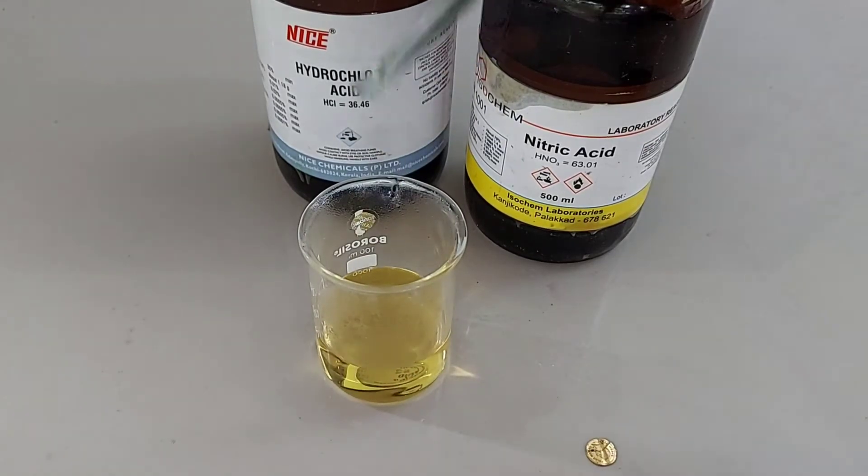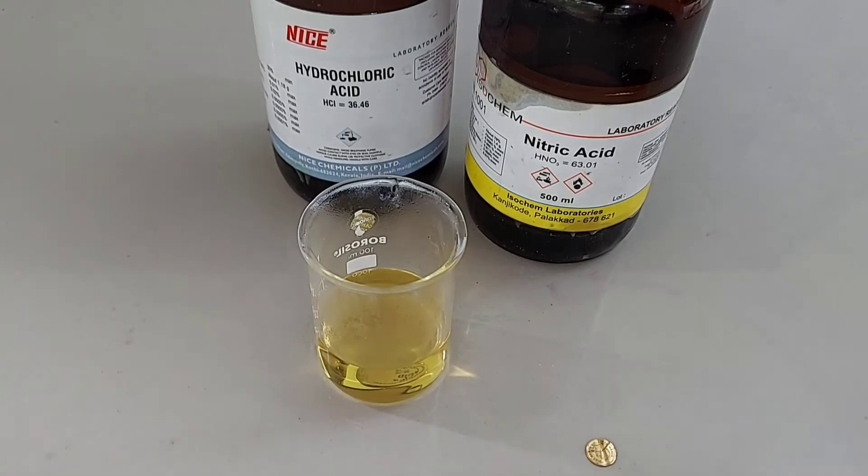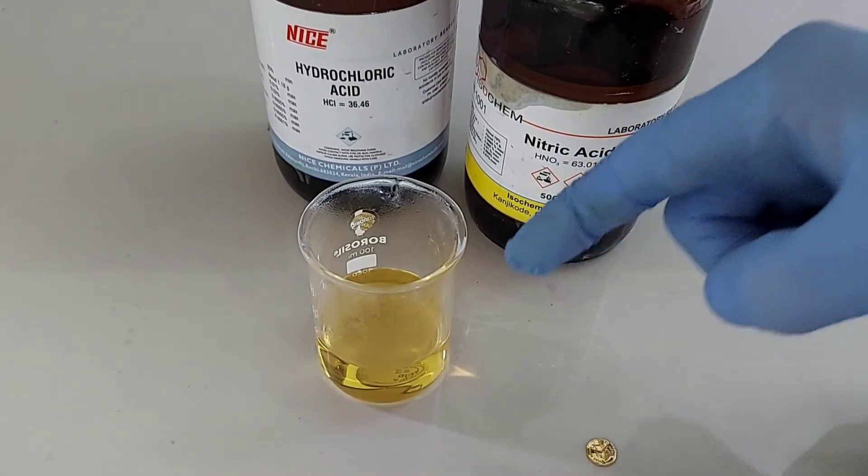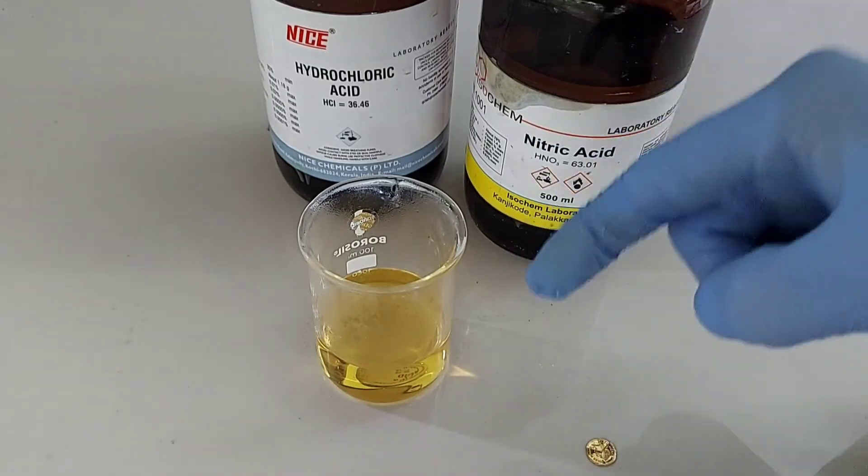Aqua Regia must be used immediately after mixing, because after some time it will eventually decompose and its strength will decrease significantly.